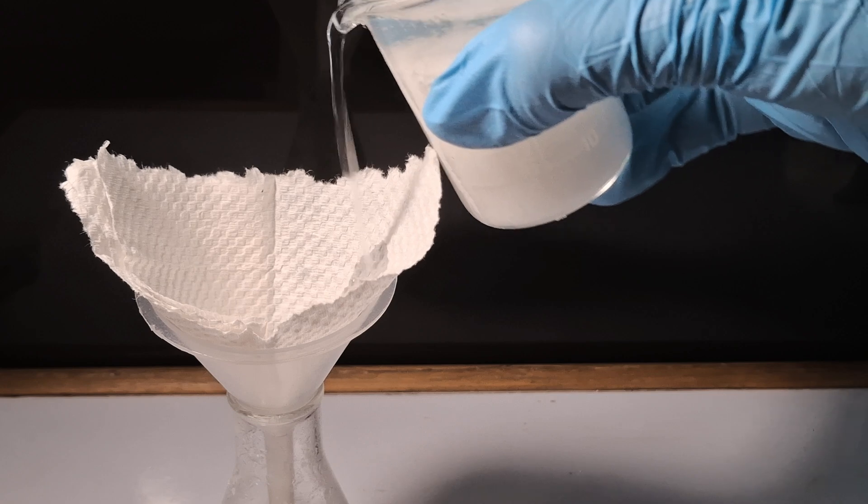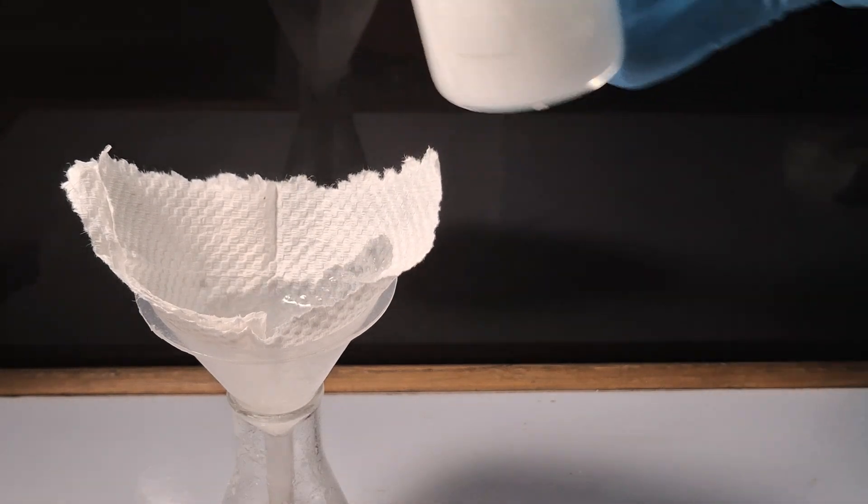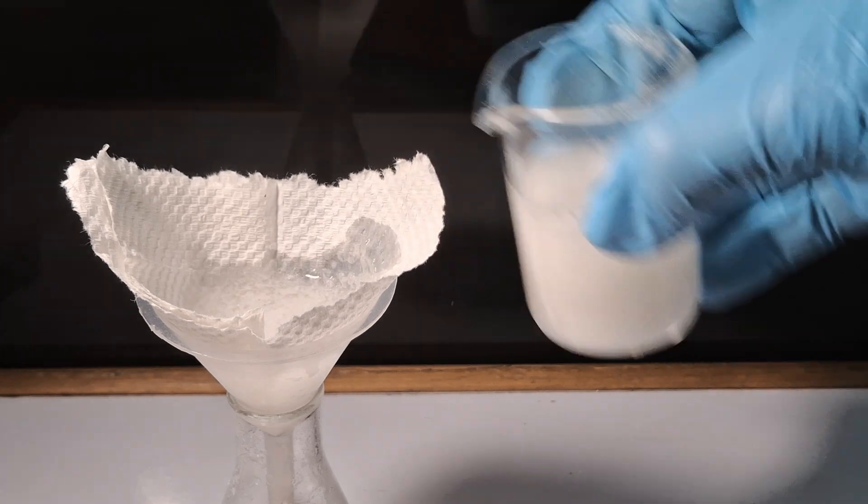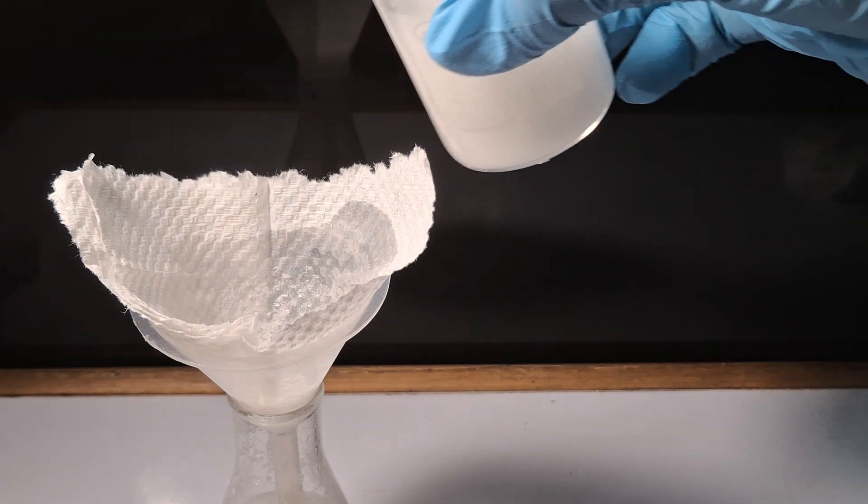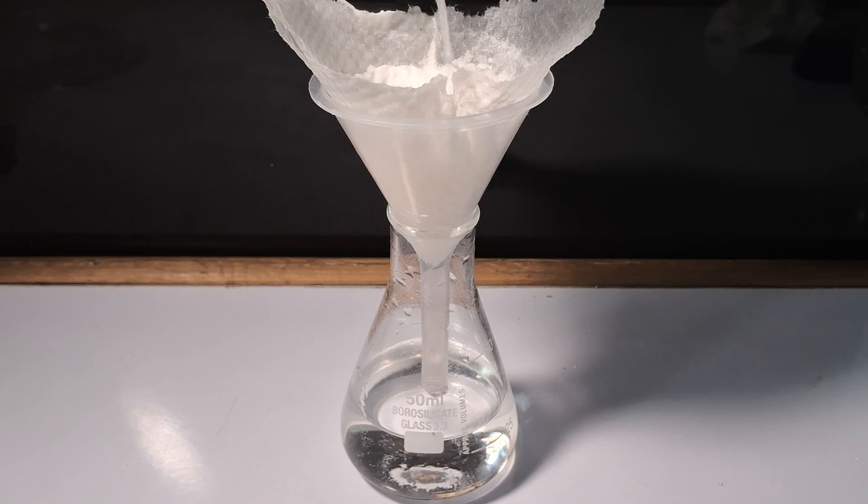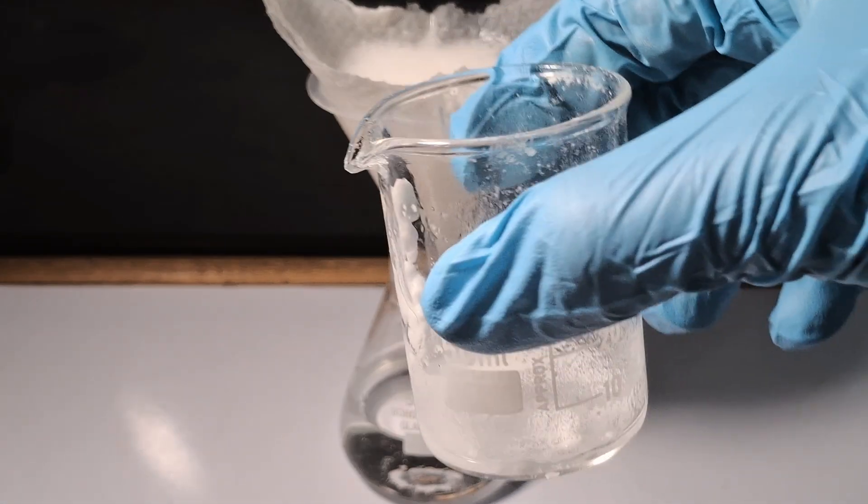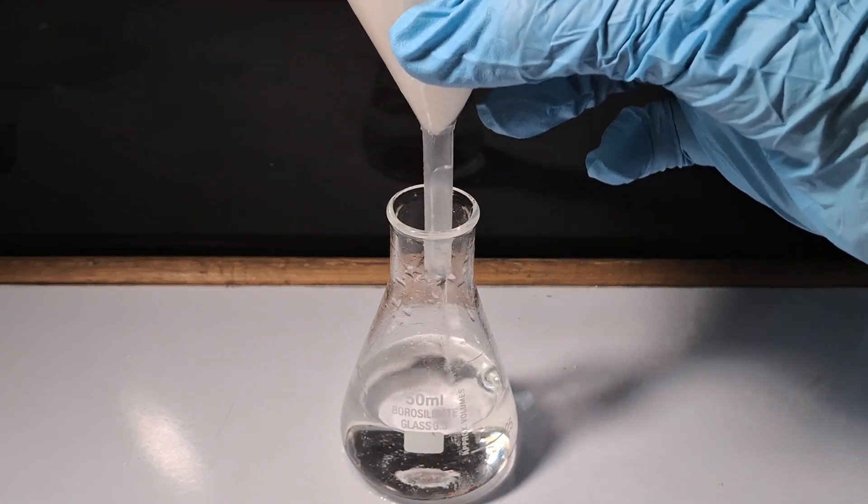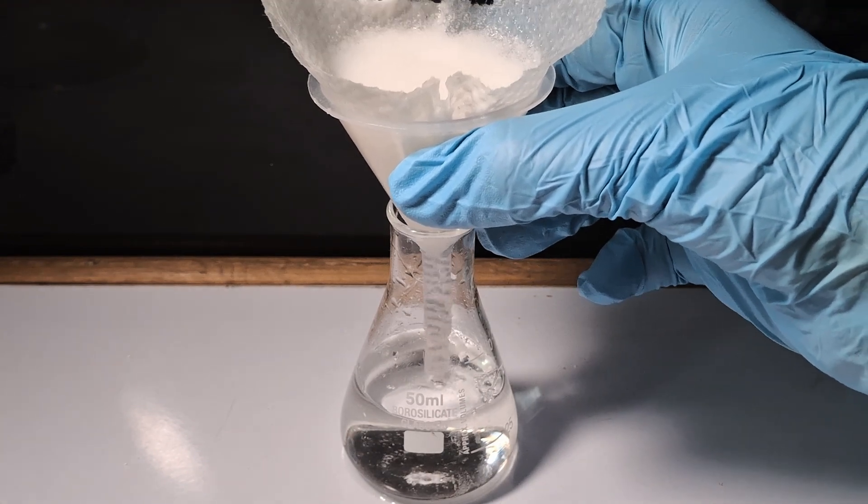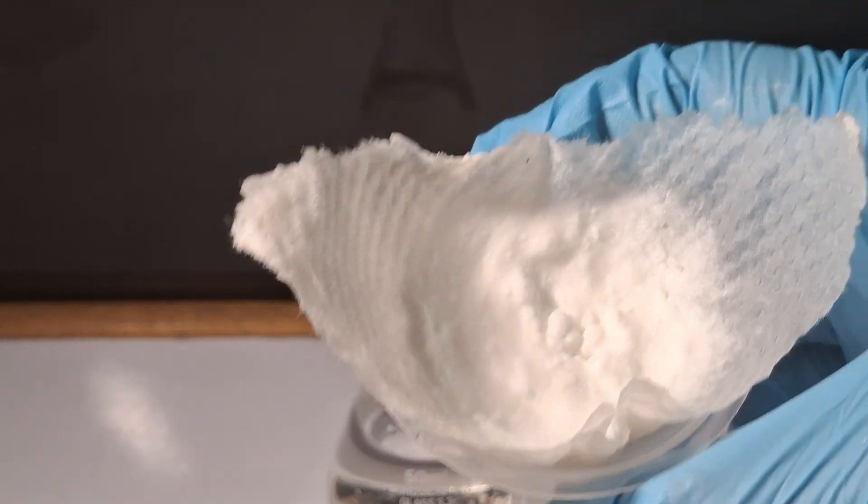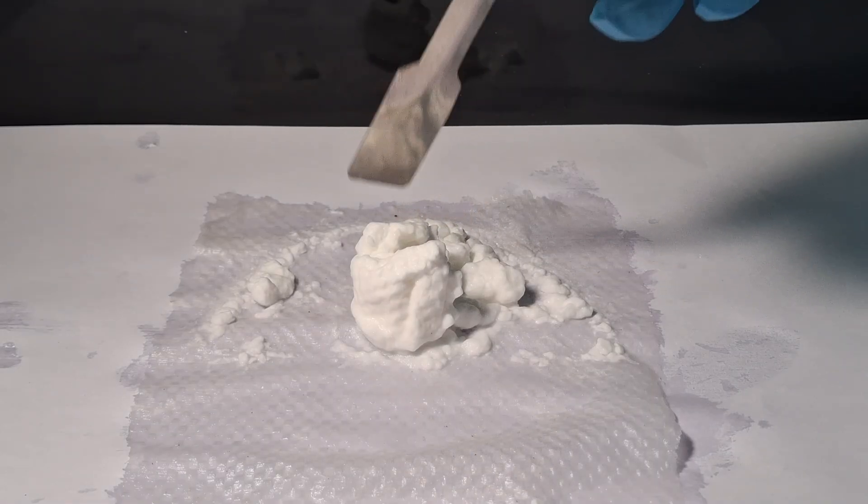The mixture is then filtered to remove the benzoic acid from the remaining solution. I continue washing the beaker with water to remove all the benzoic acid. Here you can see the paste-like residue of the benzoic acid.